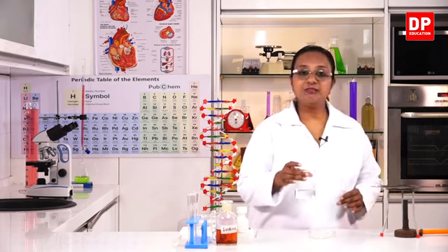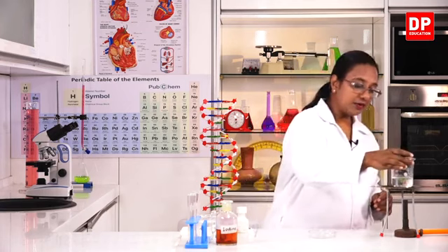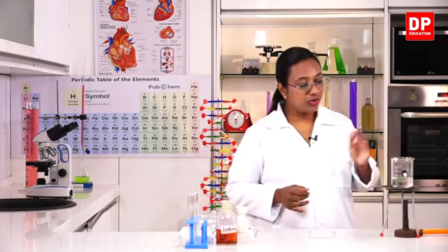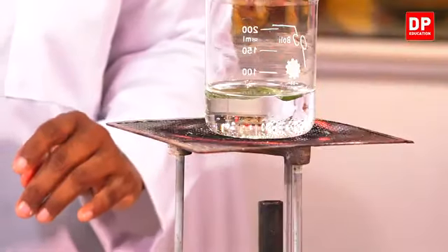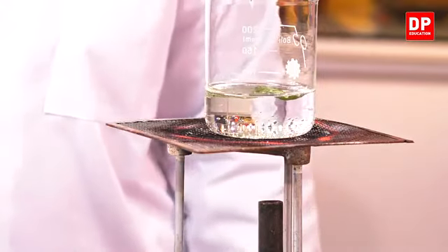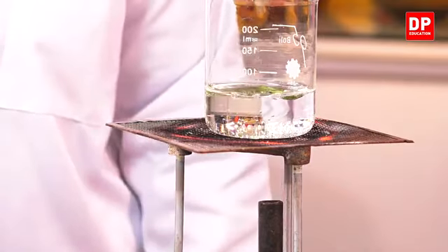I have selected a leaf that can fit into this beaker so that it is easy for us to boil it and take it out. So I have the burner ready and now I have kept it to boil. You will have to observe the changes that are going to take place here. Initially, you saw that the leaf is green in color. So students, now you can see when the water is boiling, you can see a change in the color of the leaf. Earlier it was green in color, now it is turning to a pale brown colored leaf.